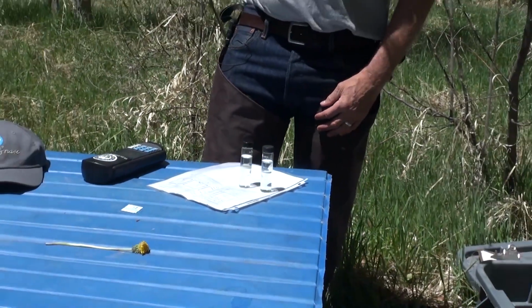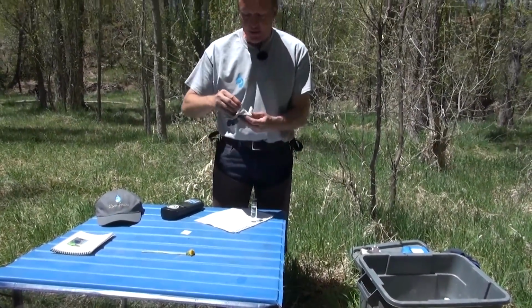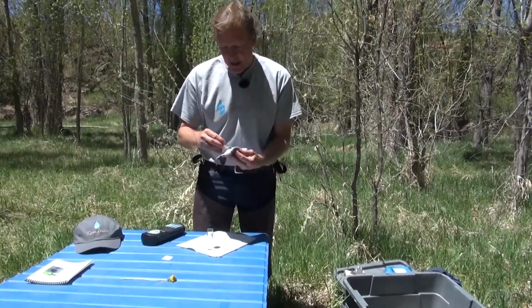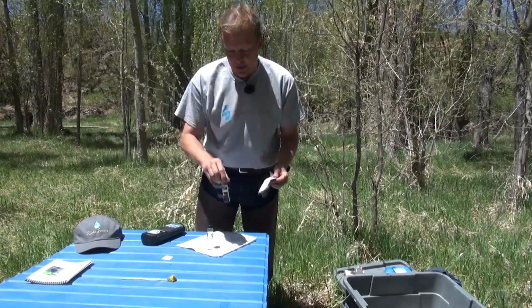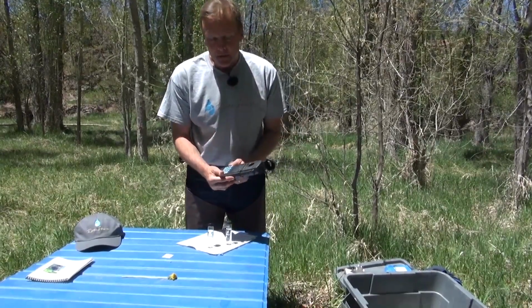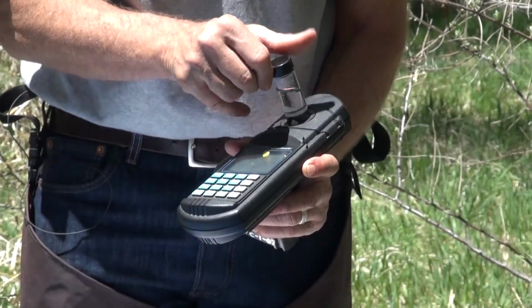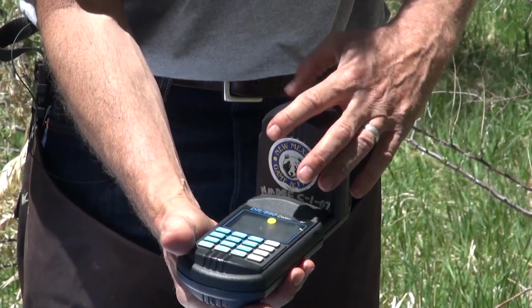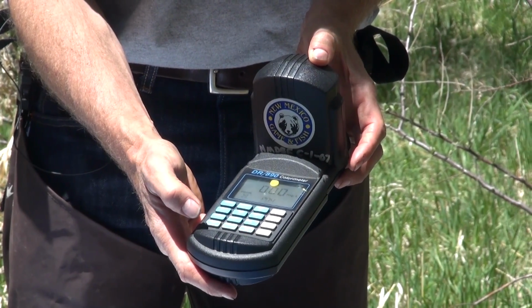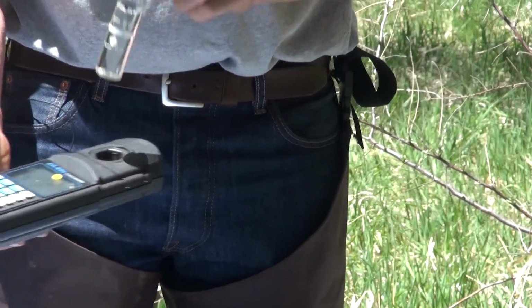All right, so the first thing I'm going to do before we run the test, now that the 2 minutes is done, is just double check to make sure the sample cells are nice and clean. This is my blank. I'm going to test that first. And then this is my prepared sample that had the reagent put in it. The machine needs to read the blank first. And so there's a diamond right on the front of that. I'm going to line that up towards the screen, and then I'm going to put this light shield over the top. And then I'm going to press the 0 button. It should say 0. Okay, it does. So that's good.